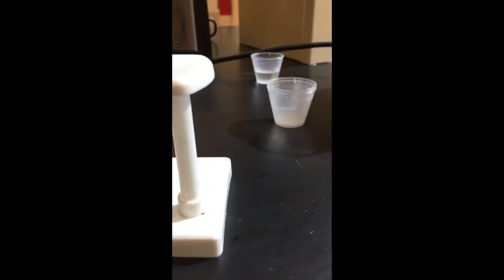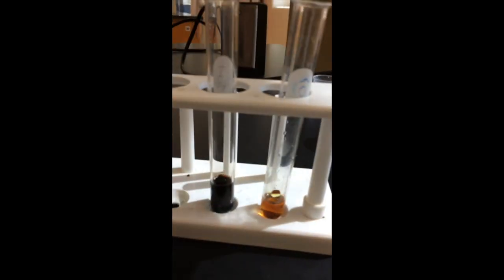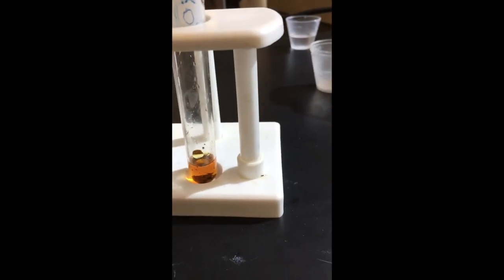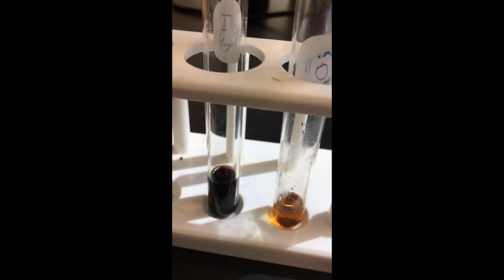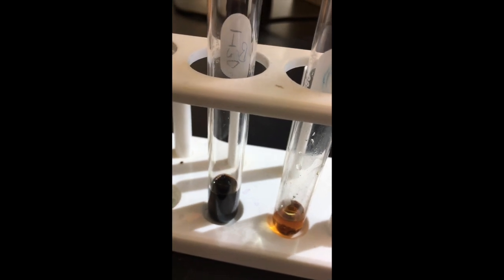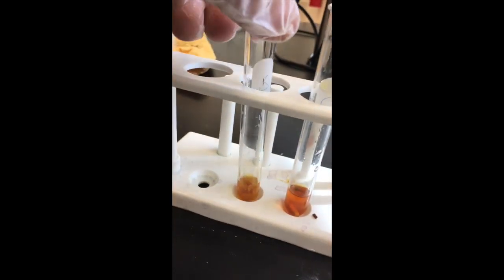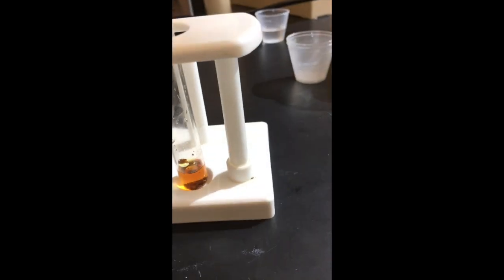So when it comes to our friend the chocolate chips, we have more of that orange red. We do not see the complex carbohydrates. Over here with our cheese, we do not see the complex carbohydrates. Over here with our salami, we do not see the complex carbohydrates. What we do see is here with, what a surprise, bread.